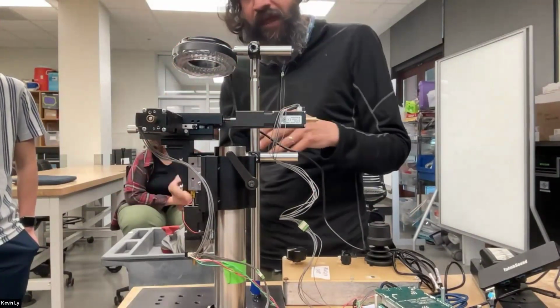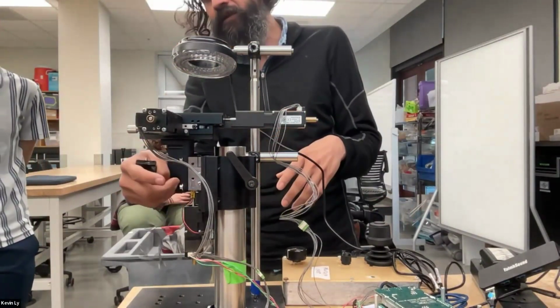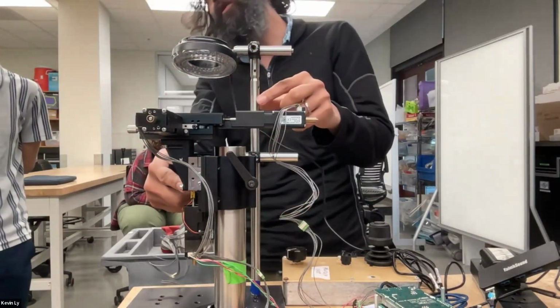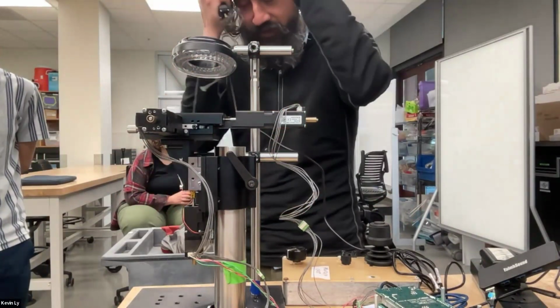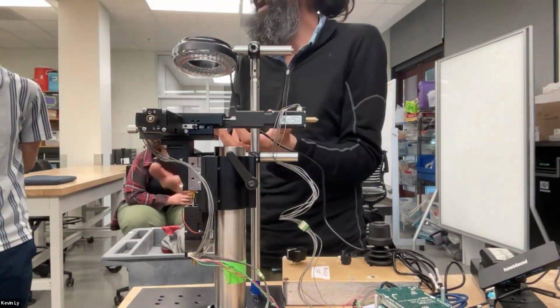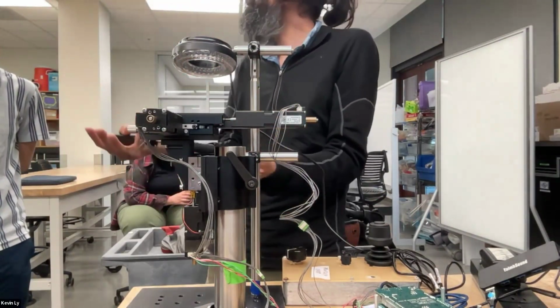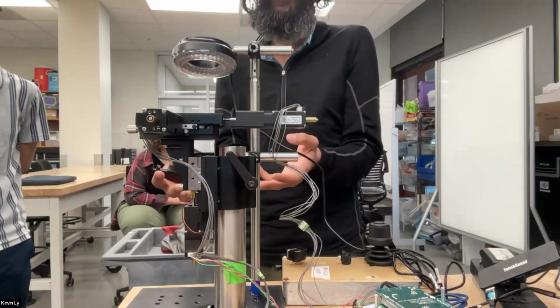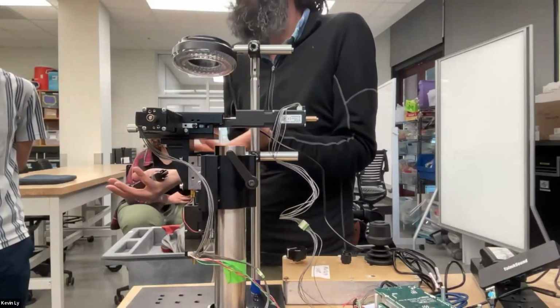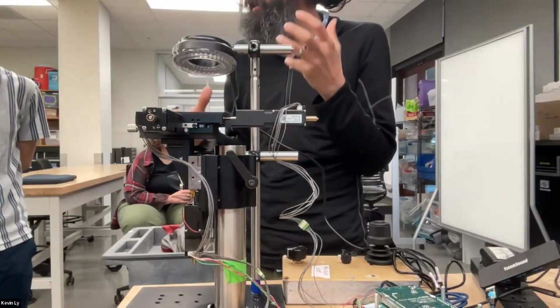Actually, the design, this is Enrico just put something together. The original design, this mounts on this, and this is on a separate post. But he's just come to the lab, so he's assembling these for the first time. But this is also cool. He figured out a different combo of putting it together. In one afternoon, when I had told him to assemble it, he actually assembled it differently, which is nice. You can start seeing the modular part.